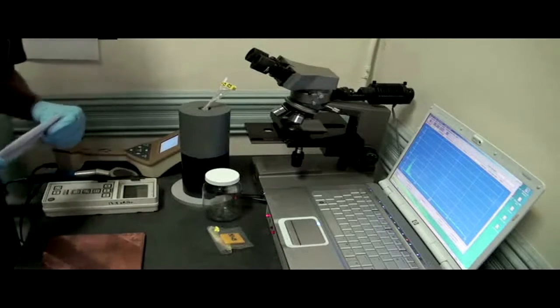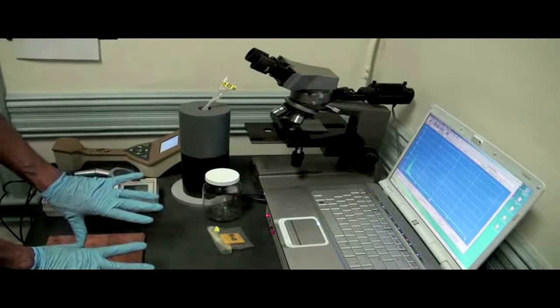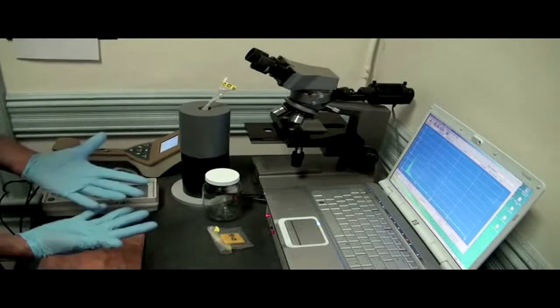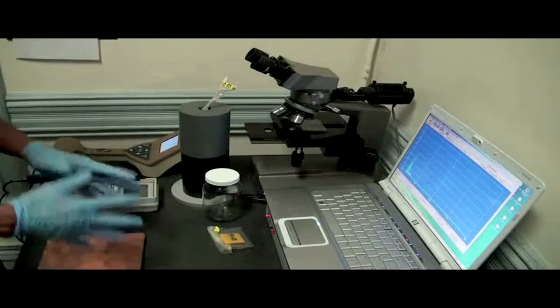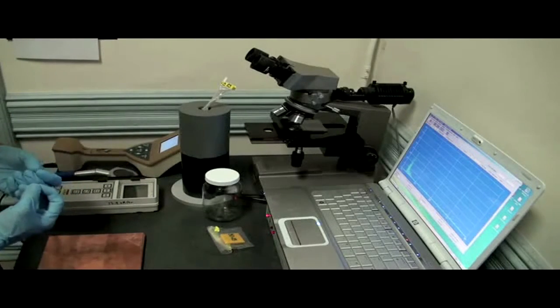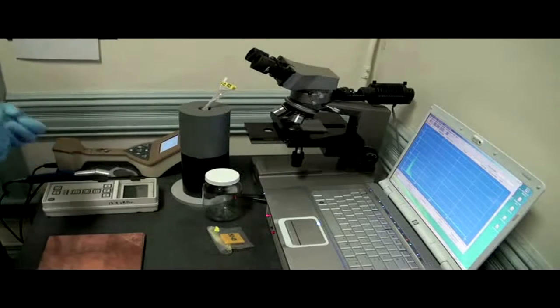A few other things to worry about, I'm wearing gloves. You should be wearing gloves when you're doing your sampling. You never know what's in the samples that you collect. And we never know what's going to be in the next box that we open. So always make sure you take that measure of safety.